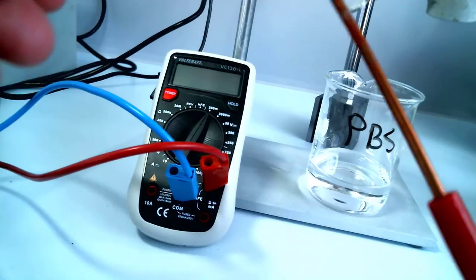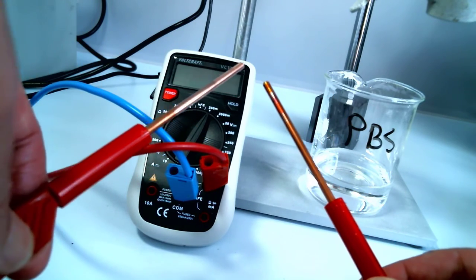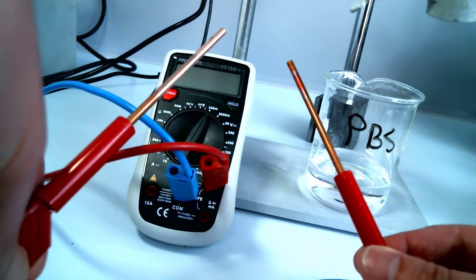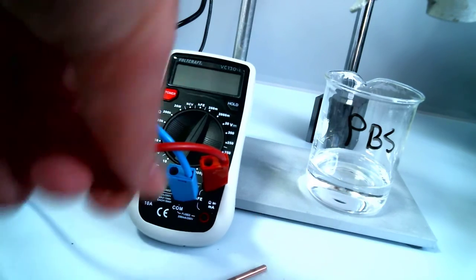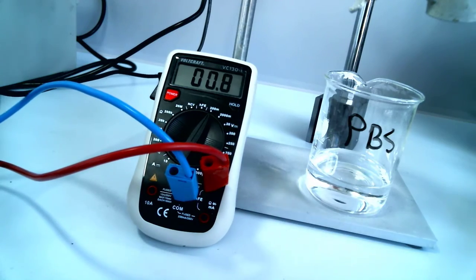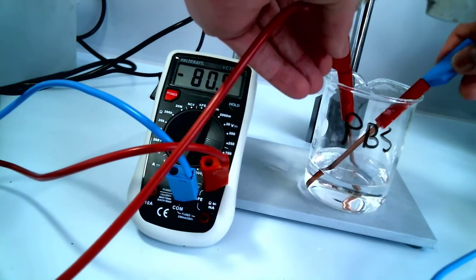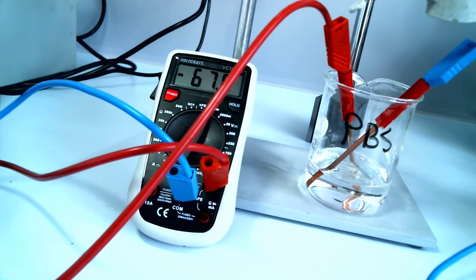So this red one is attached to the red. The oxidized one is attached to the blue, and we're going to put them in. You can see again the difference in color, apparent color. So it's effectively a very bad reference electrode. The reference electrode would be very similar. We will see that in a moment.